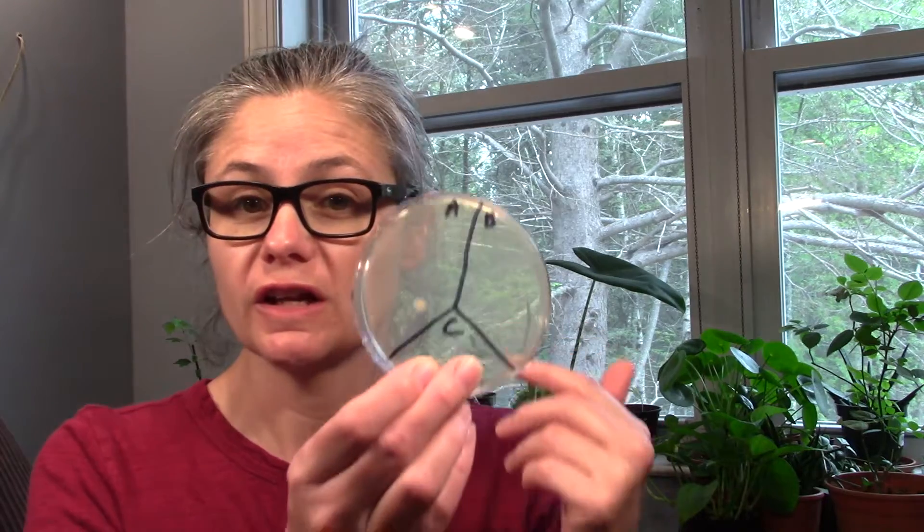What I'm going to do to test the hydrogen peroxide in the toilet bowl is the same way I test all my other cleaning products for disinfecting power. I'm going to take a petri dish like this one — this is one from another experiment — and I label it A, B, and C. I'll take a sterile swab, swab the inside of the toilet bowl, and place it on area B for before.